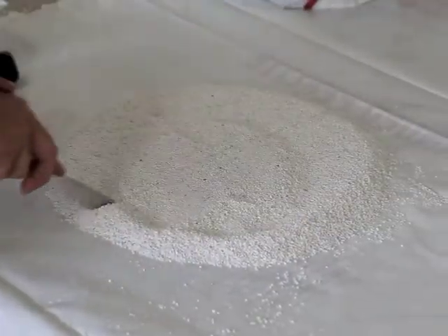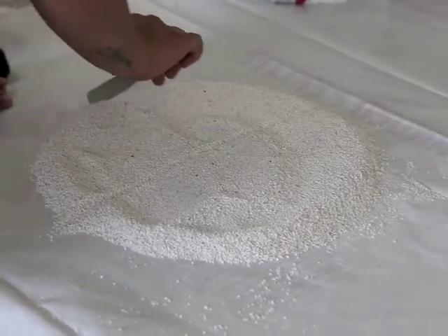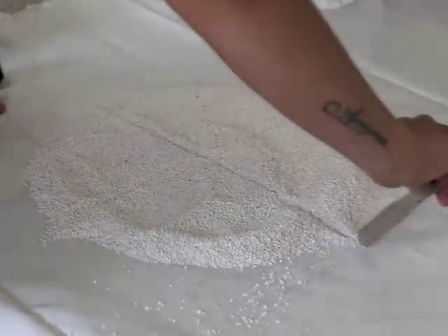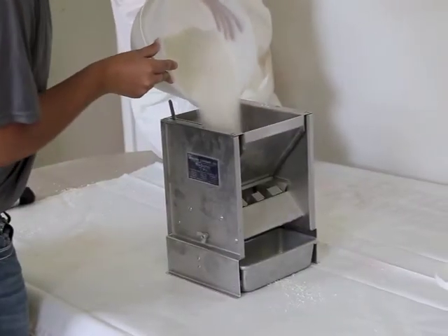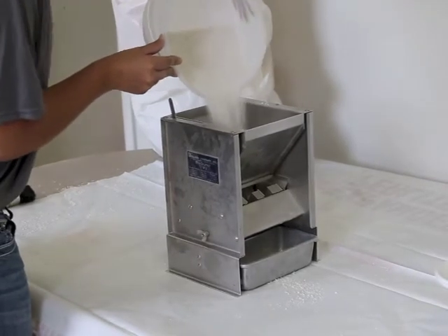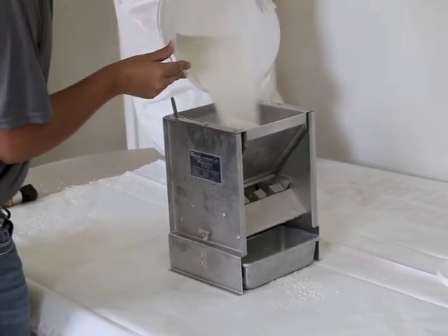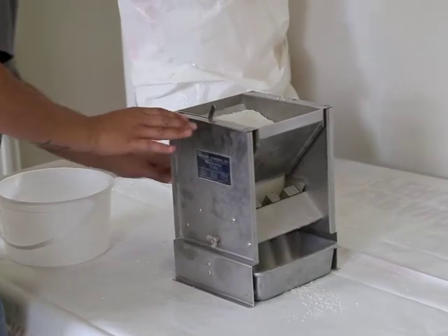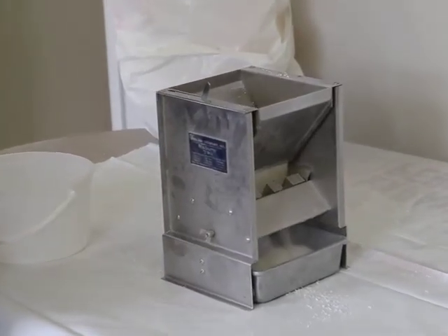Samples secured in accordance with the previous steps shall be reduced by coning and quartering, or by means of splitting and riffling, so as to obtain samples of proper size for individual tests. Riffling is the preferred procedure for perlite aggregates.